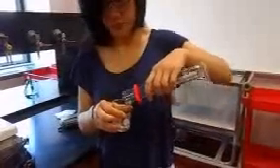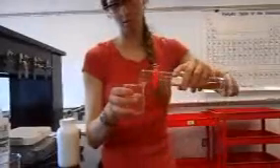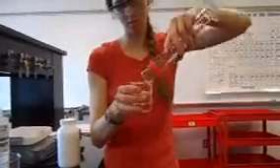The first step is to pour 25 milliliters of water into each of the 300 milliliter beakers. We will be testing freezing point depression and boiling point elevation. The first beaker will have no antifreeze, the second beaker will have 3 milliliters of antifreeze, and the third beaker will have 6 milliliters of antifreeze. Measure this out using the 10 milliliter graduated cylinder and pour into beakers 2 and 3 accordingly.